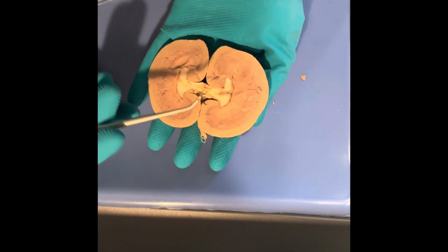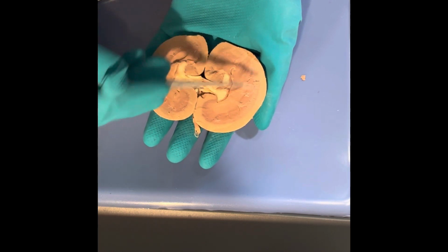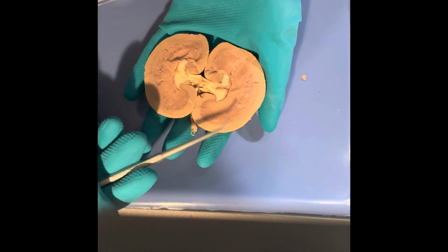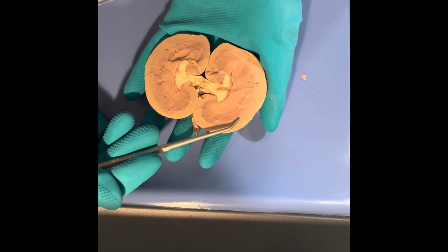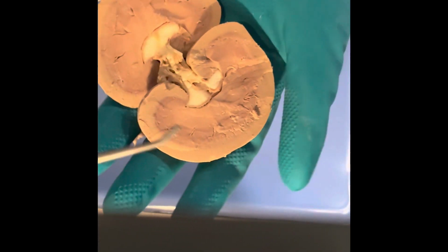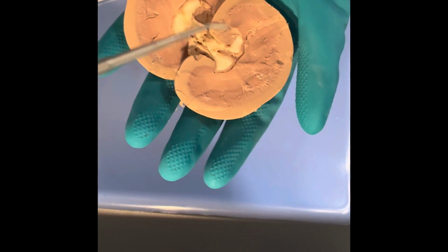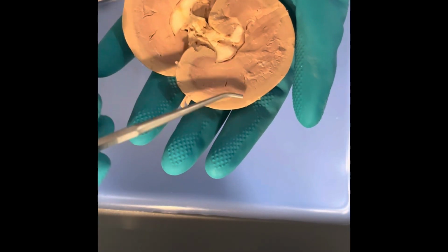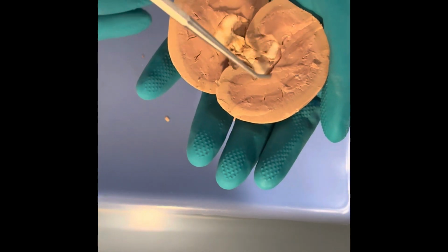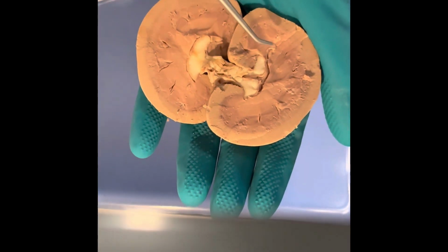So continuing to look at the renal cortex up here, that's mostly where all of the nephrons are located, and we can begin to see the collecting ducts. The urine is going to travel through those and go into the renal pyramids. After the urine is collected in the collecting duct, it's going to travel through the renal pyramids down into the calyxes. It's going to collect there. You can see down here, those would be in this area.